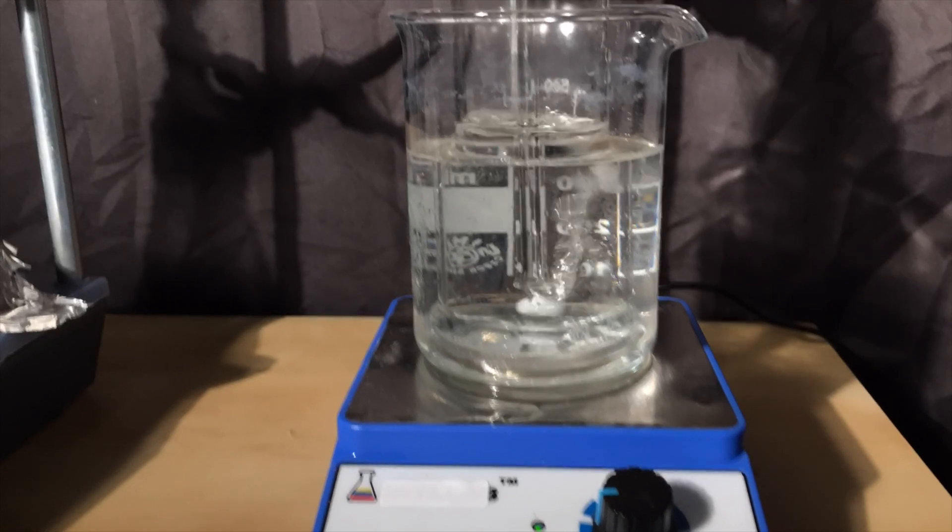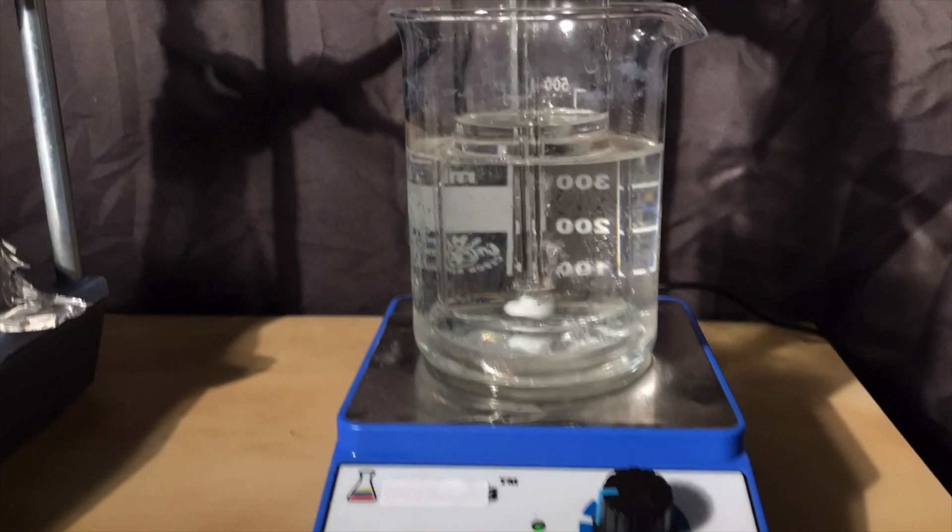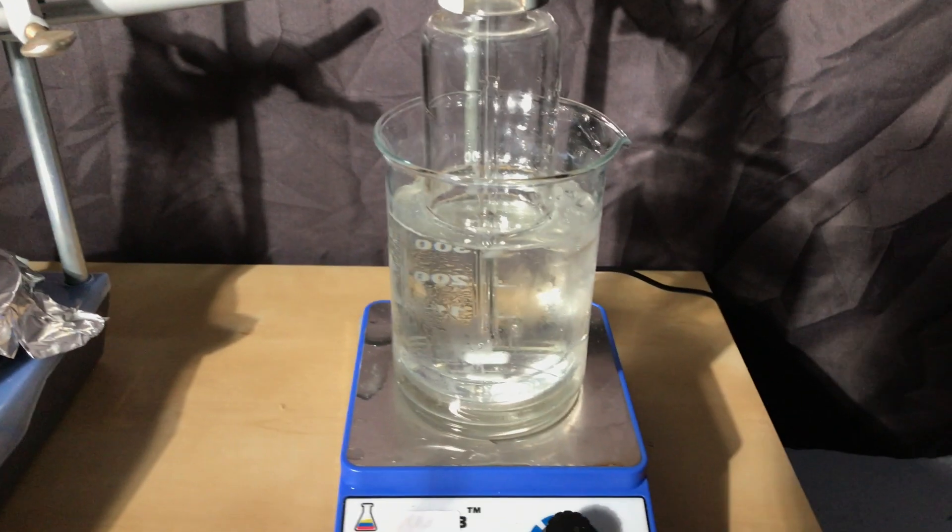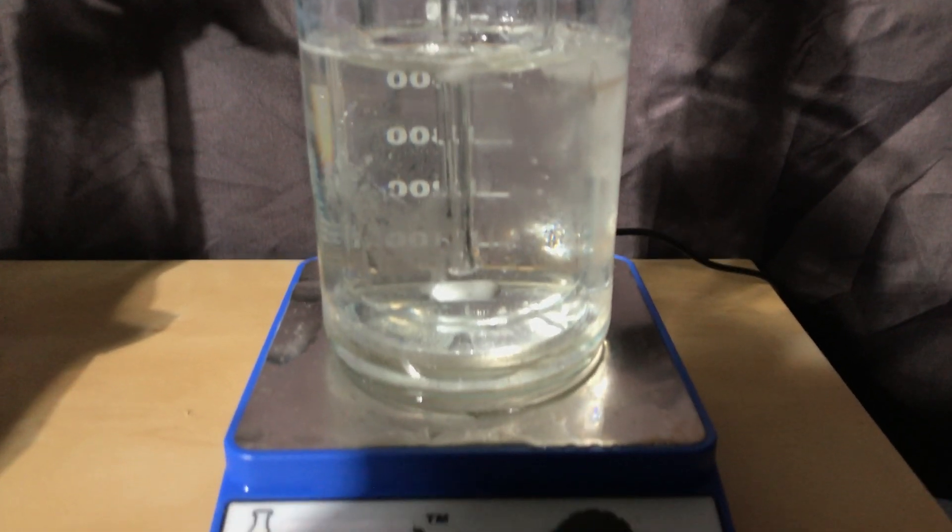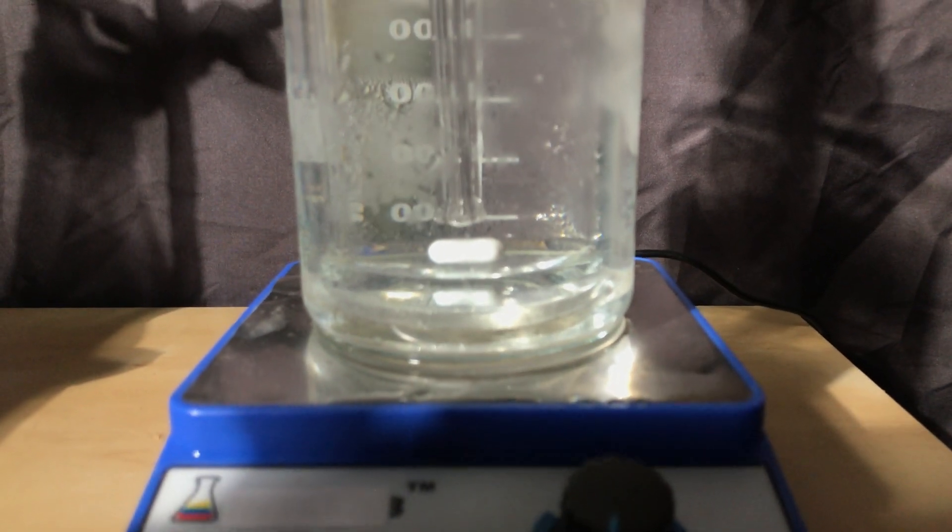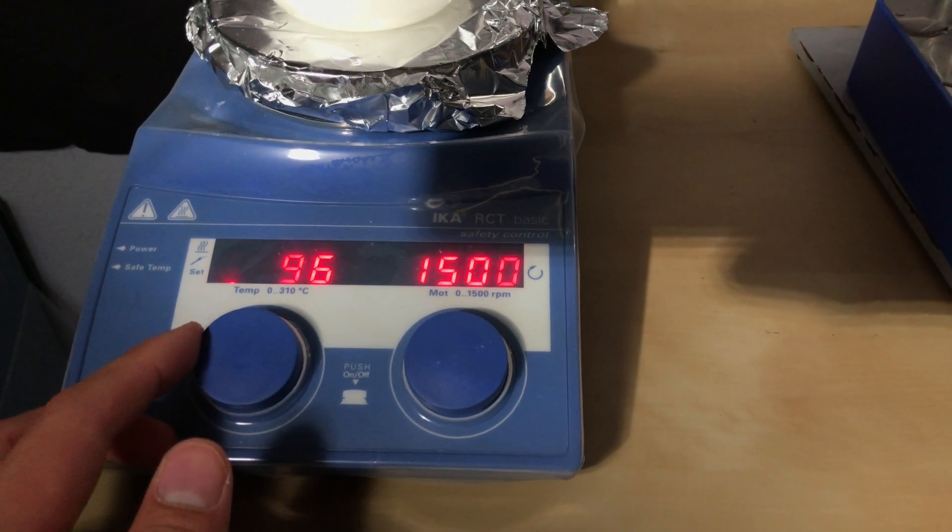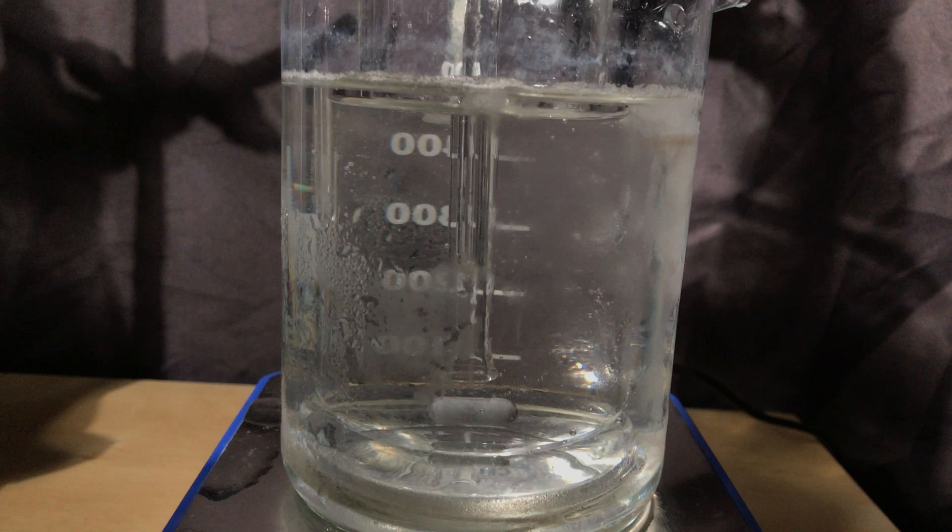The volume of liquid in the washing bottle increased rather quickly. It's important to carefully supervise this preparation. Towards the end of it the dimethylamine is going to be sucked back through the tube. No more dimethylamine gas is being produced and therefore the liquid won't be pushed down back into the apparatus and will be sucked back into the boiling flask.